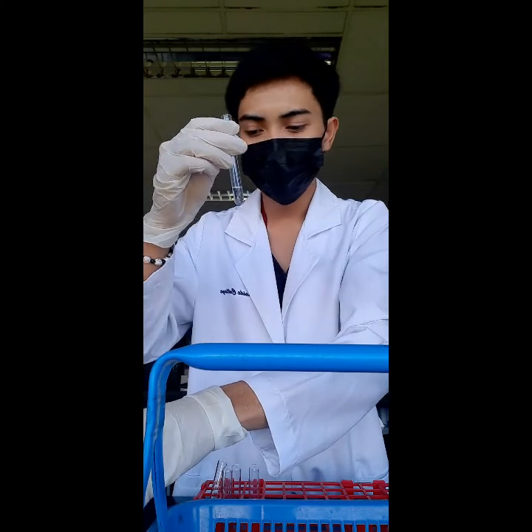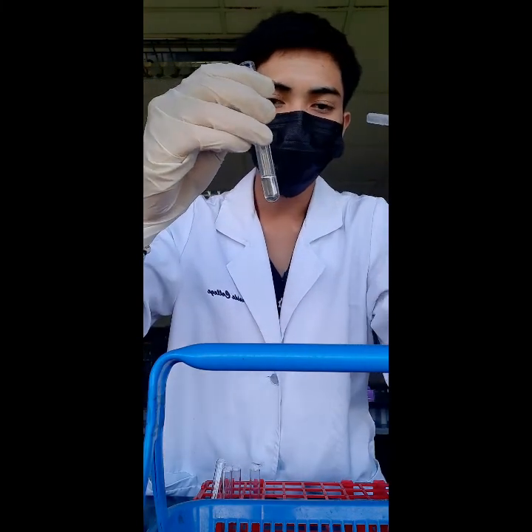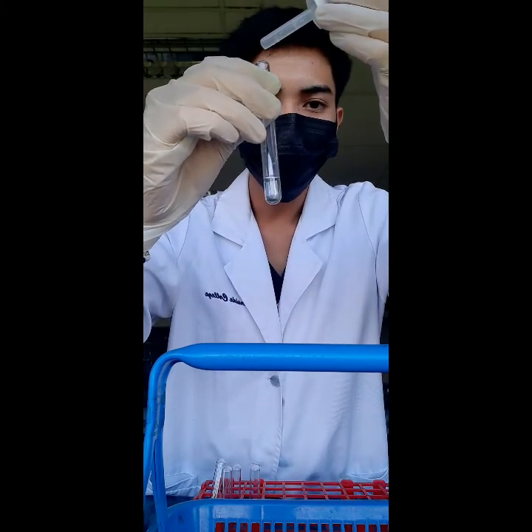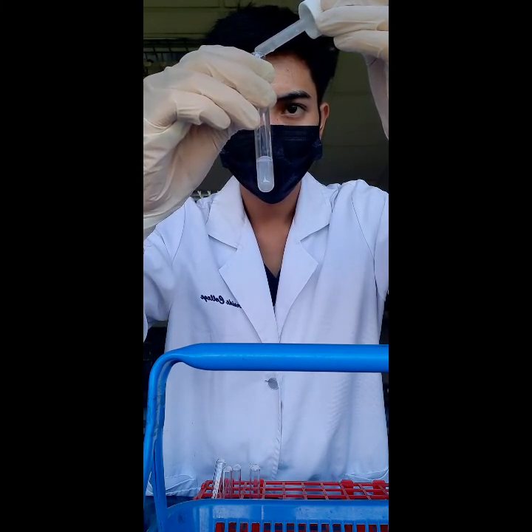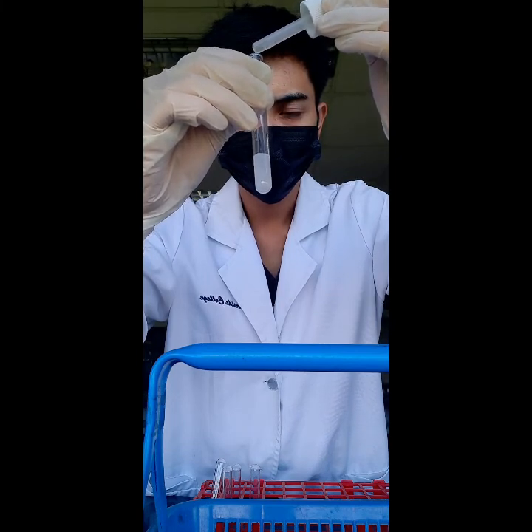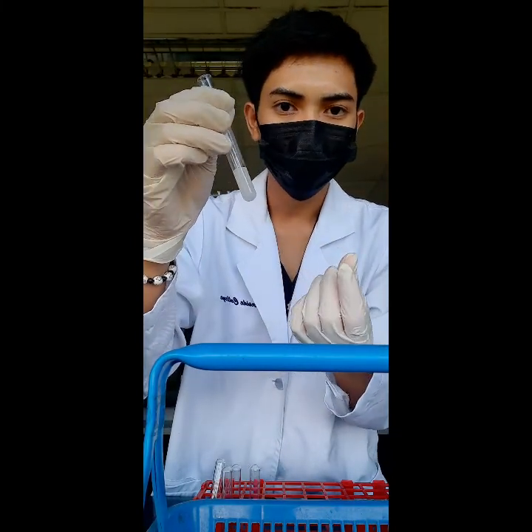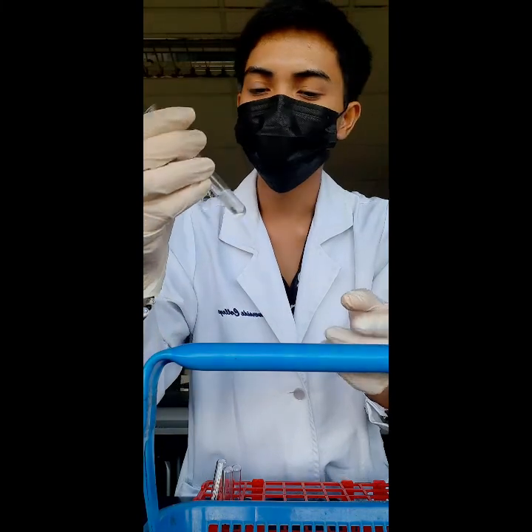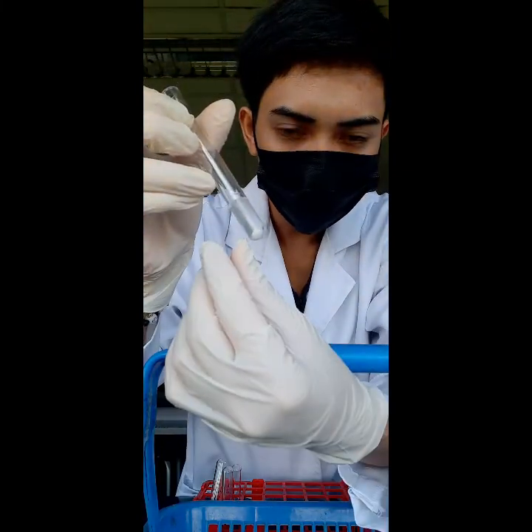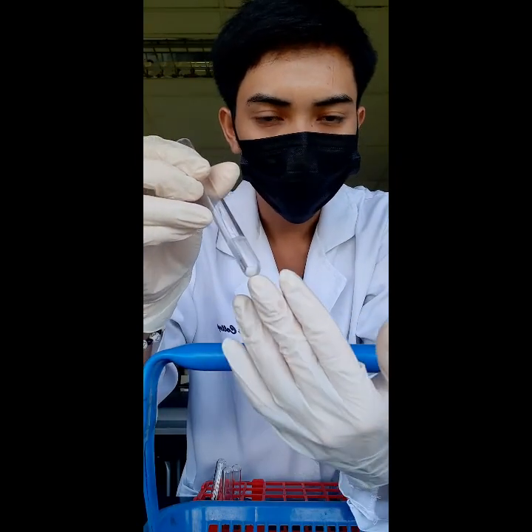Lastly, we add 10 drops of our unknown solution to our test tube. Please take notice of the change as I add our unknown solution — 10 drops of it. We then centrifuged our test tube containing all of the solutions we've added to it for 5 minutes. Right after centrifugation, our solution forms white precipitates, which would confirm the presence of this particular compound belonging to our Group 1 anions.